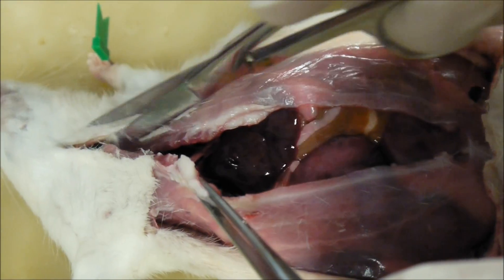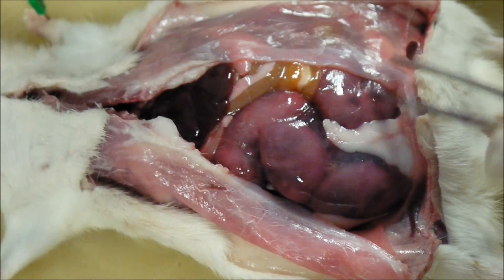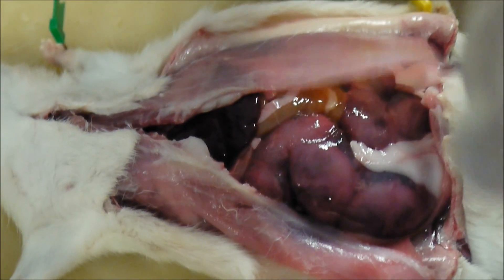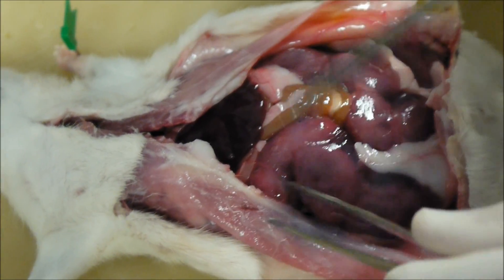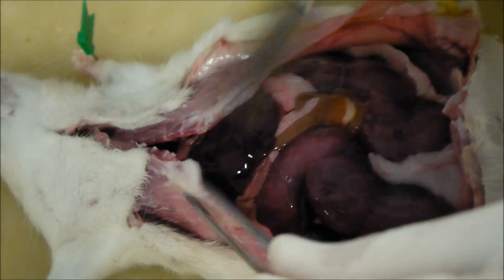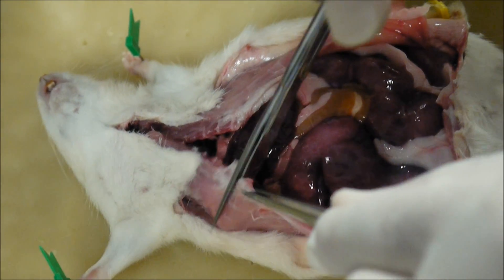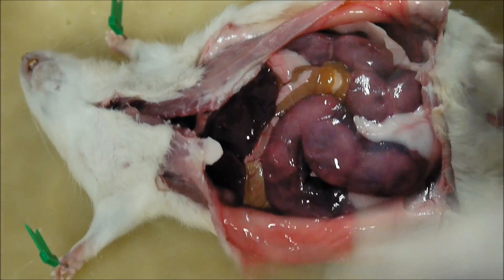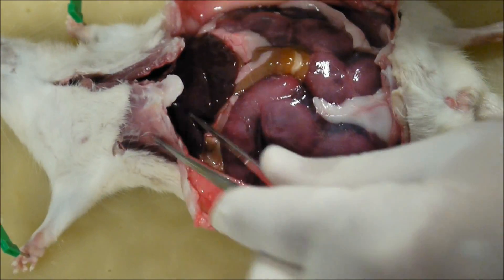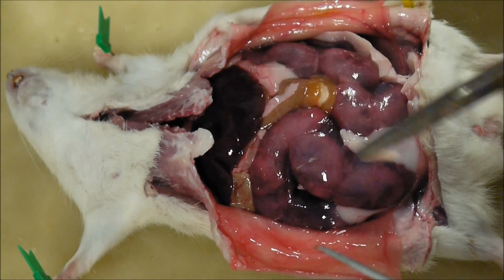So I'm going to cut in here, take it right up, cut this way and we go this way. You see the muscle layers are not very thick — the wall of the abdomen — but of course it's also been stretched because this female is pregnant. I'll just cut here under the diaphragm and pull that back for all of you to have a look. Now we can identify — look, there are a lot of fetuses in here. These are the fetuses here.